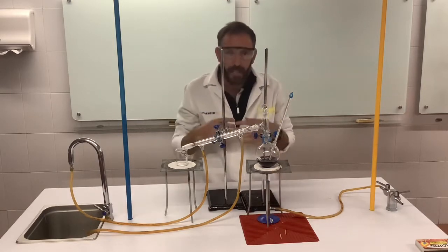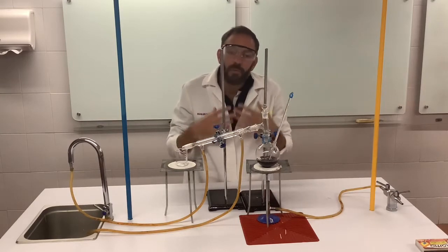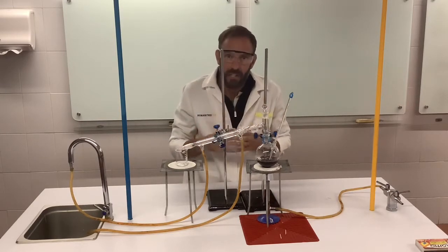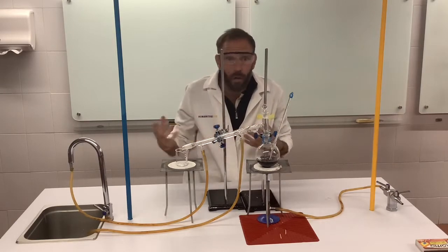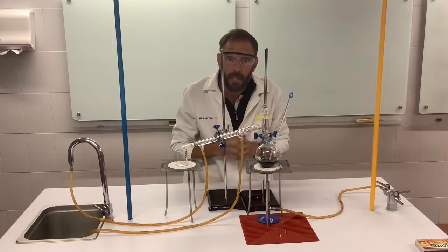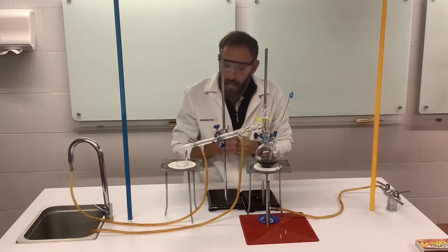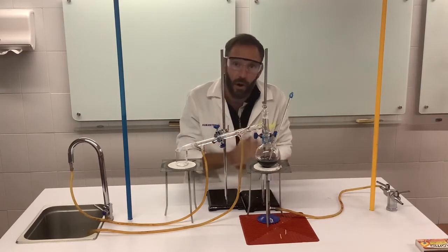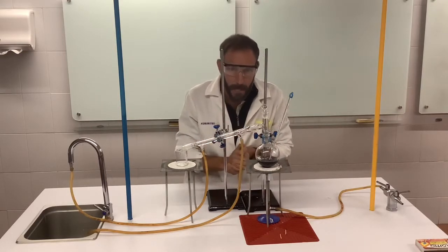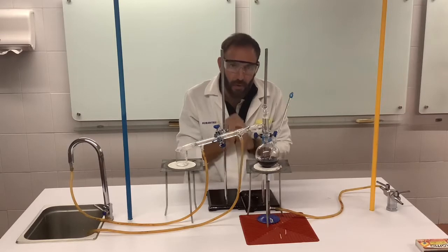Now in the lab, this is how chemists would go about analysing what the alcohol content of alcoholic drinks is. Yeah, and it's quite simple. You evaporate all the alcohol off and you see how much alcohol you've got, and you work it out as a percentage of your drink. Okay, so that's all for now. Let's see if we can get pure ethanol from this.